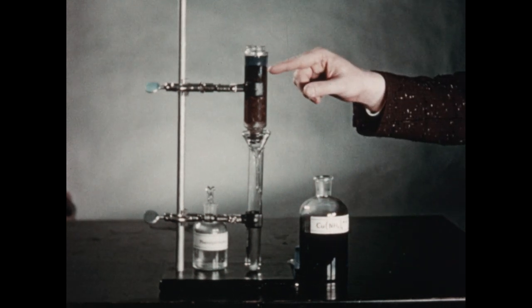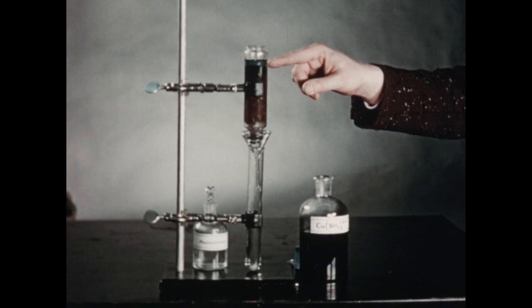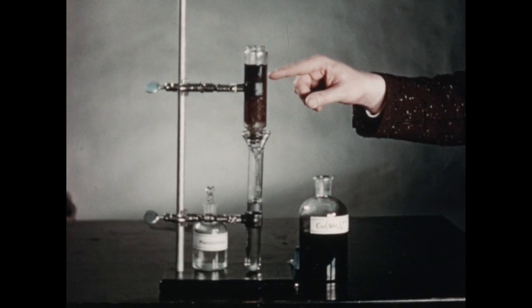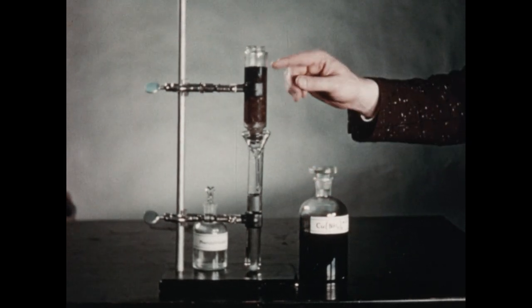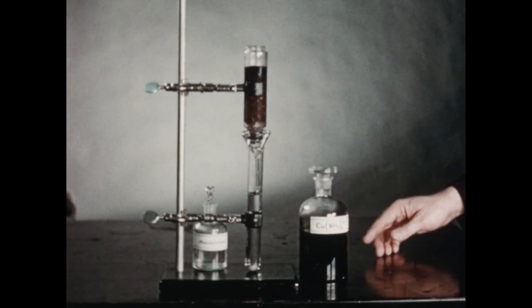Now, in the tube, we have the equilibrium between the cupric ion and the copper-ammonia complex, and the ion exchange resin is removing the copper ion, replacing it with two sodium ions. The ammonia, which is another product of the reaction, and the two sodium ions should pass into the collecting tube.